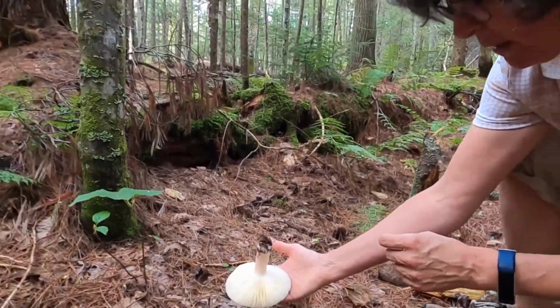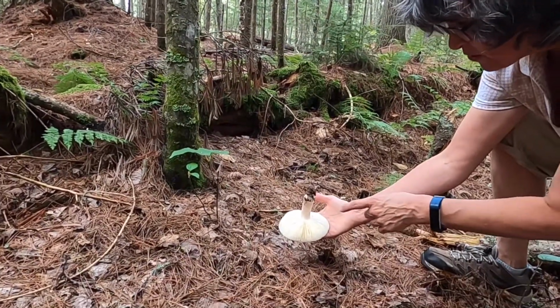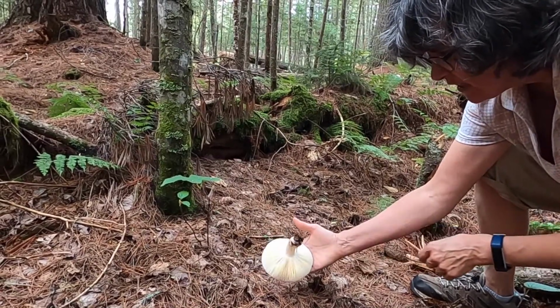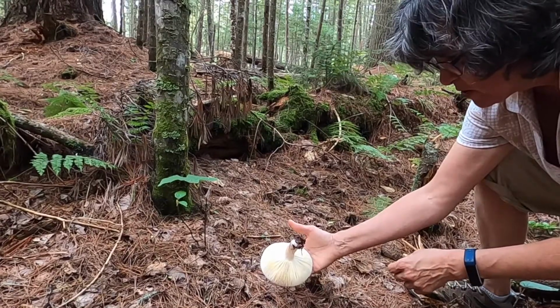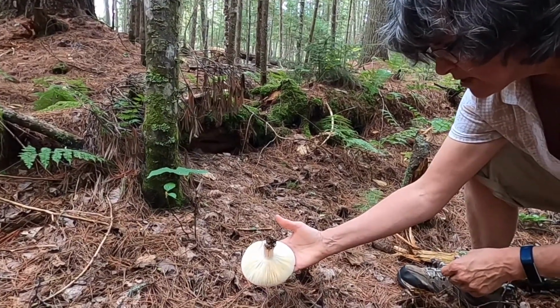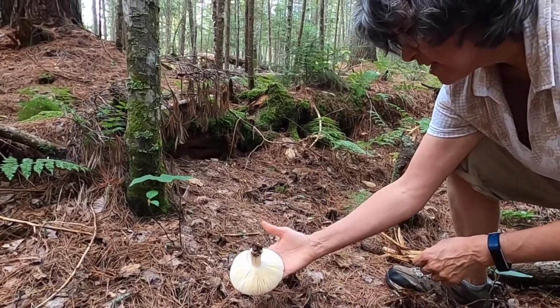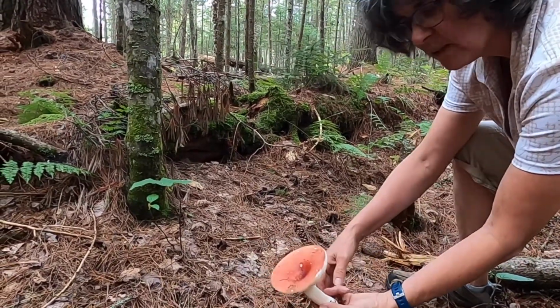So the spores themselves are microscopic, and we wouldn't be able to see the structure that's producing them, but those club-like structures are going to be lining both sides of each one of these gills. So think about each club-like structure producing 4 spores, and each gill here would be lined with thousands of those club-shaped structures, and you can sort of start to think about how many spores this single fruiting body would be able to produce. This is a beautiful specimen.